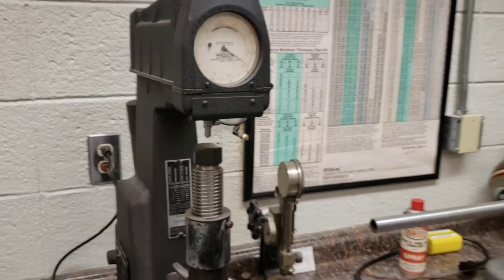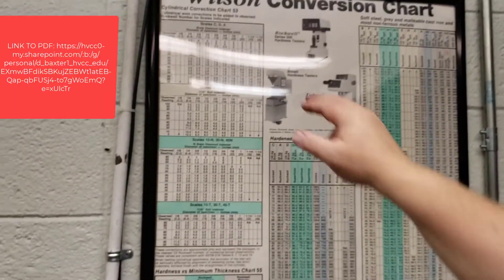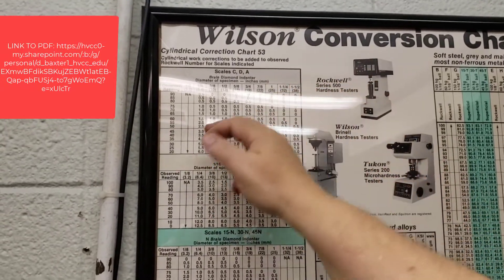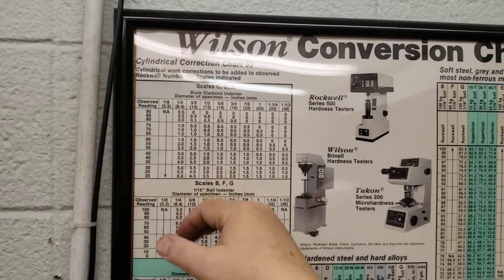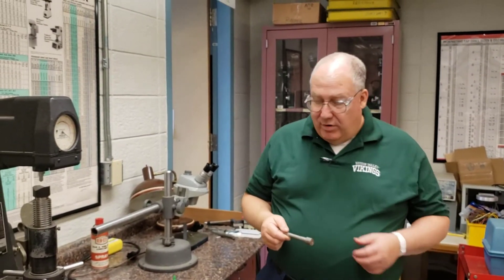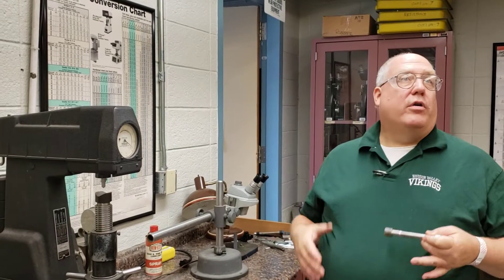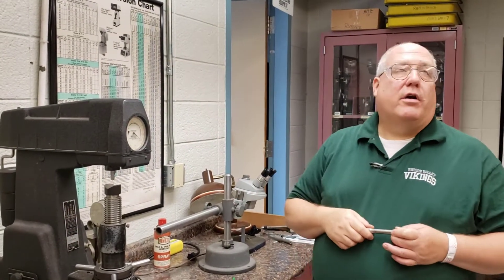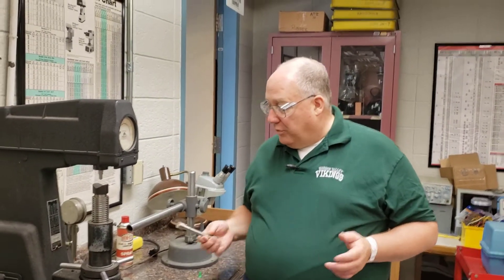Is the test done? Do we know the answer is 74? It is not. We need the conversion charts — we have a PDF of this so you don't need to be in the lab. We say C scale, we observed a reading of 74, and this is a half-inch diameter, so we add one half. So 74.5 or 75 would be the reported reading. You always have to add because the specimen is curved, so the Brale doesn't make full contact like it does on a flat surface. The less the curvature, the smaller the correction, but you must use the correction chart. We have several in the lab and you have a PDF as well. Now you know how to test round specimens using the Rockwell scales.